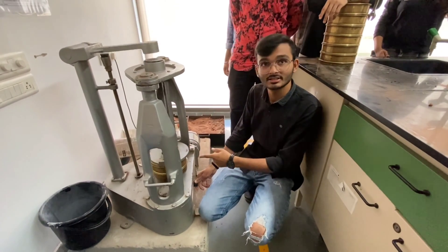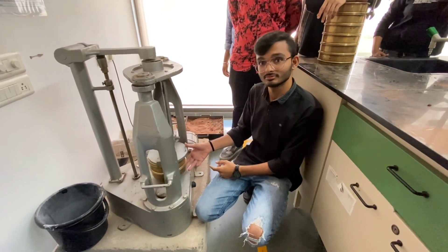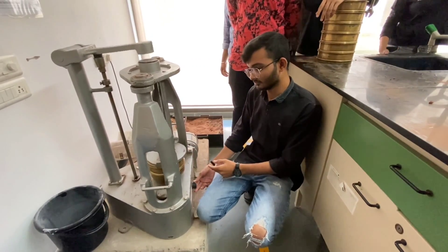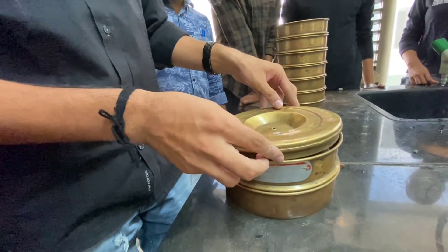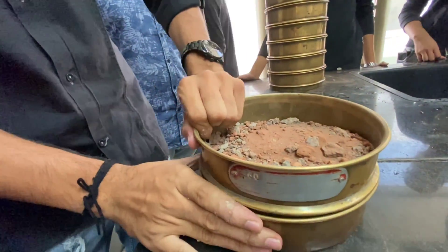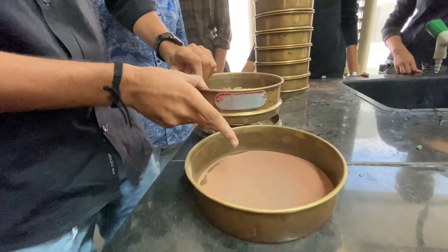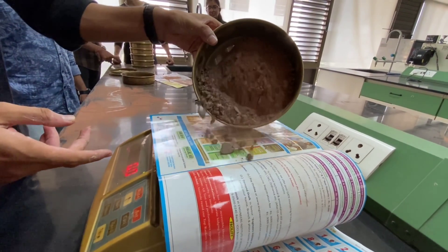Then we shake the screen using the screen shaker. The material remaining on top of the screen is the oversize particle, and the material passing through to the bottom is the undersized particles. Then we weigh the oversize particles.